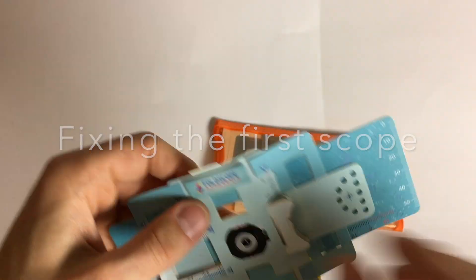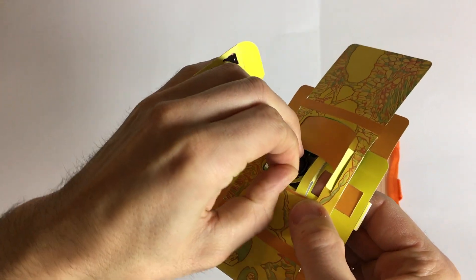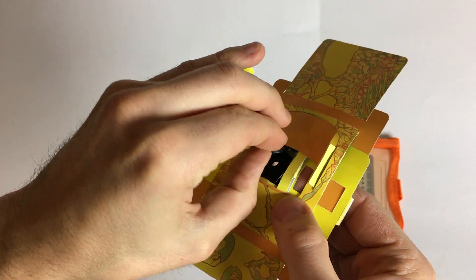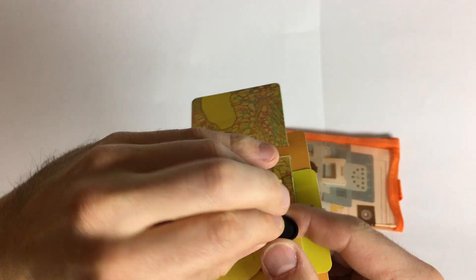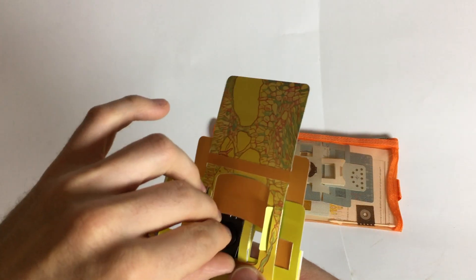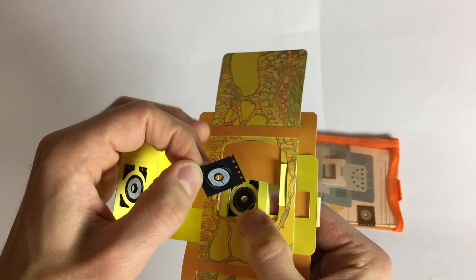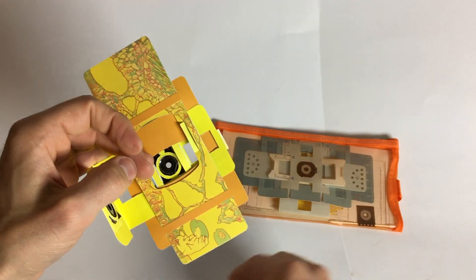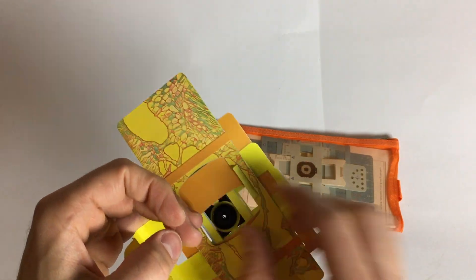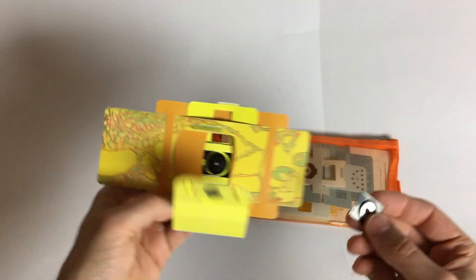How do I get the lens out of this one? Double fail — I didn't put the lens in there; I glued the wrong piece in. That's not supposed to be here. Okay, I fixed it. Perfect.